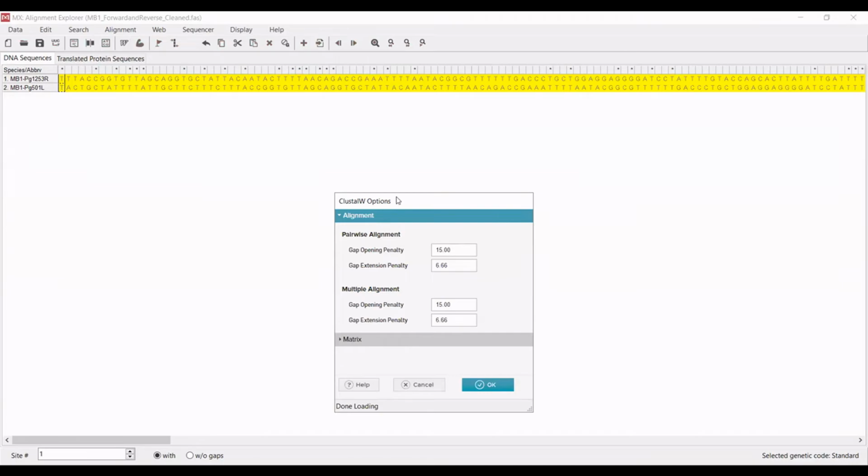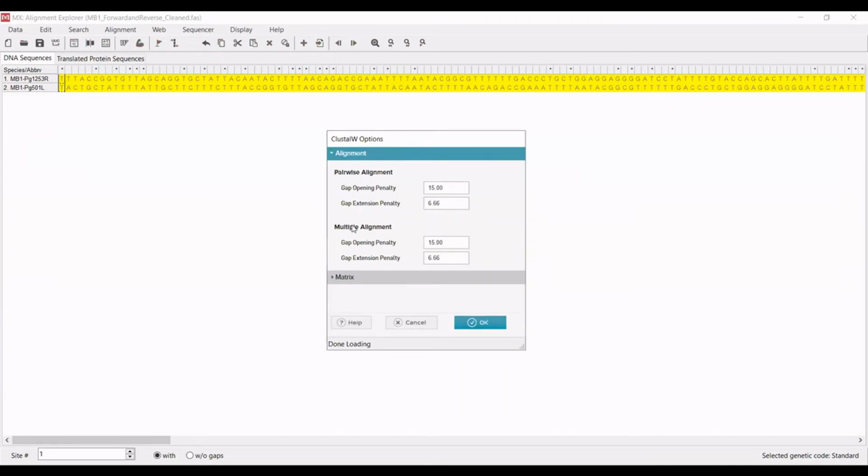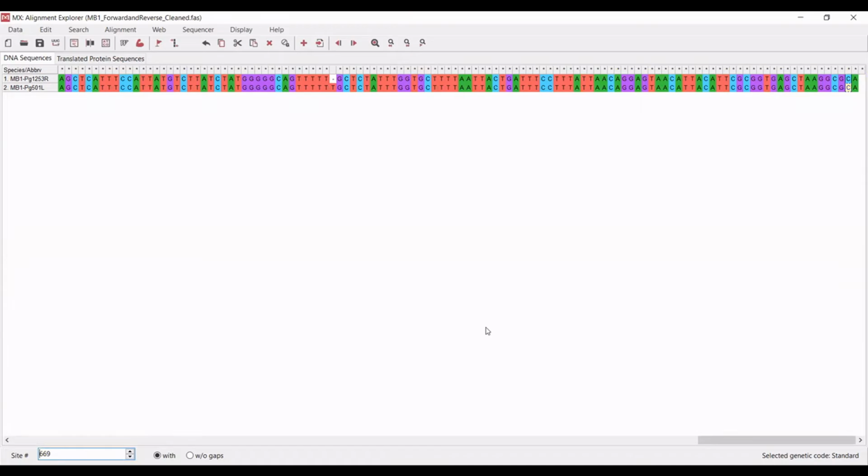And hopefully this shows up, but if it doesn't, an options window has appeared, which allows you to adjust the gap opening penalties as well as the gap extension penalties. I typically use the defaults embedded within Clustal W. So I don't change anything. I just hit OK and it runs the alignment. Now, of course, as you can see, we only have 2 sequences here. So an alignment takes no time at all. But if you're working with a really big data set, yeah, this alignment can take quite a bit of time. So allow yourself time for your program to run.